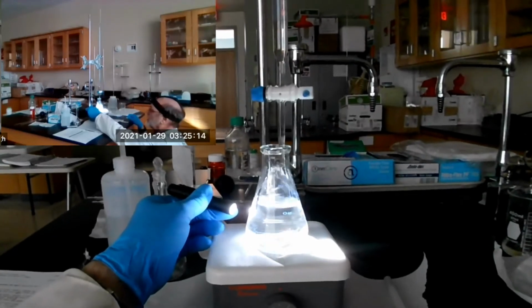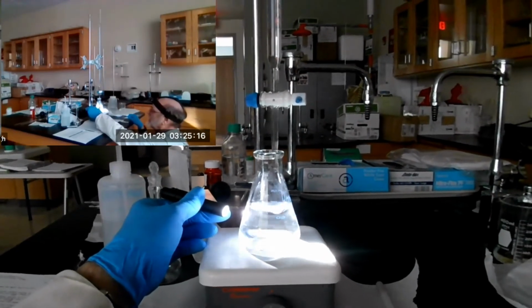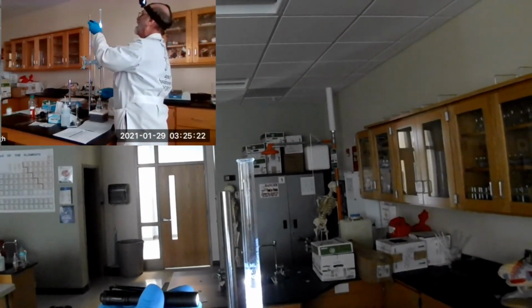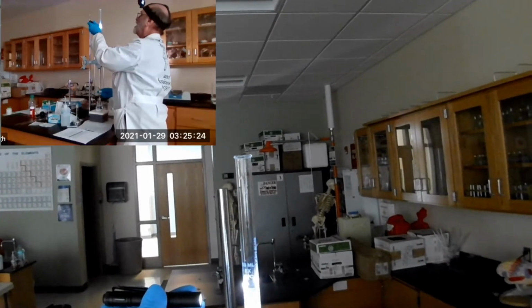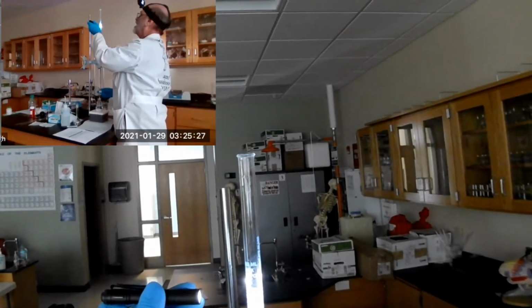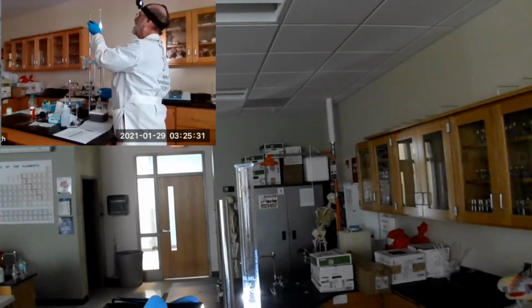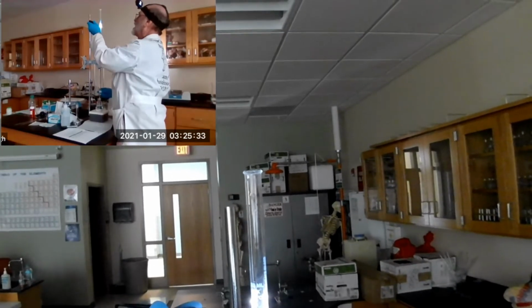Yeah, it's gone. Okay, so let's dispense a little bit more. Maybe 3/4 of a mil. Don't want to go past the endpoint.